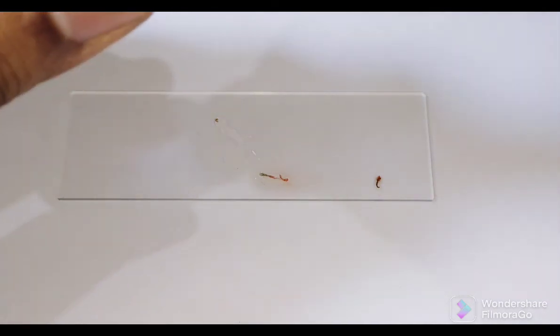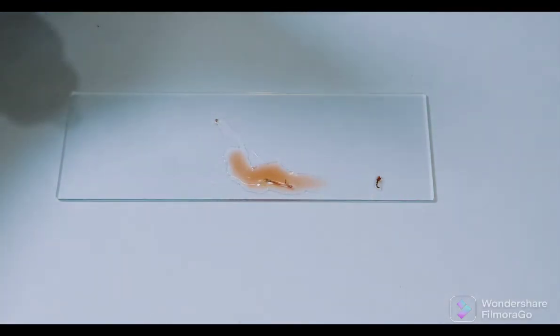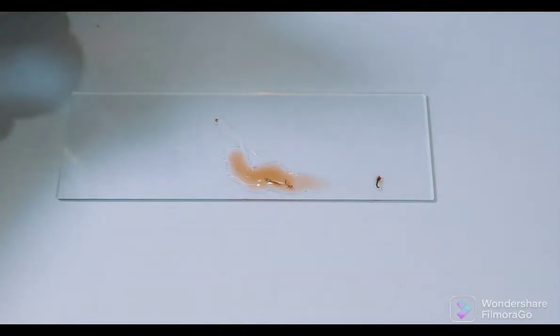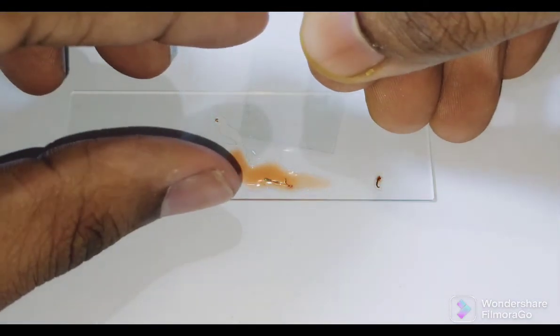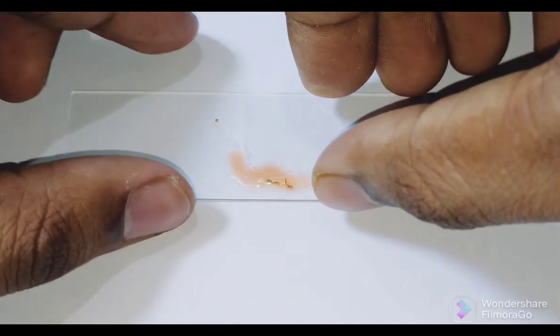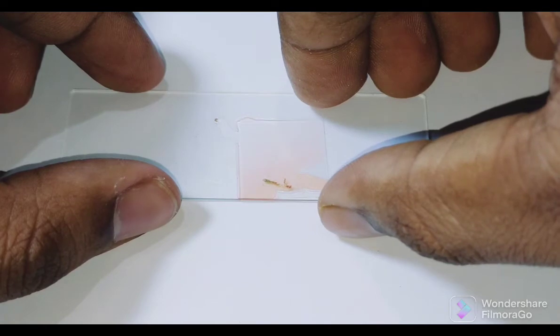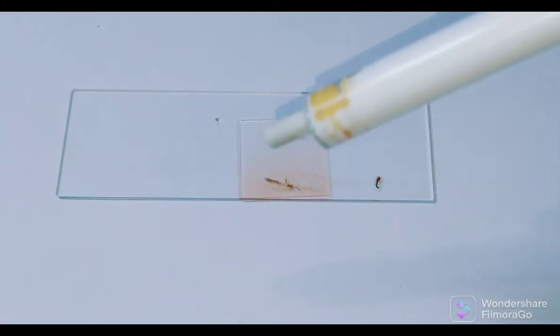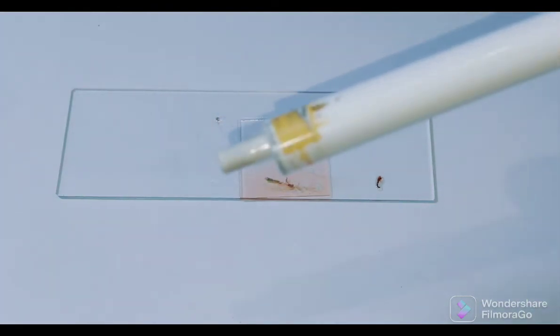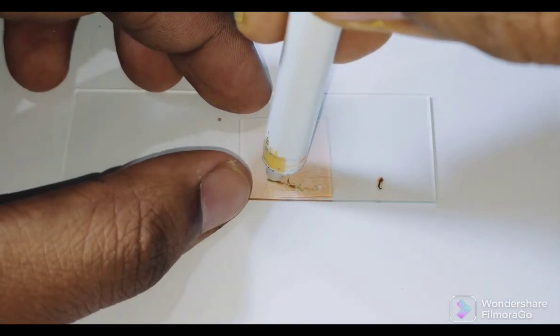Now give the acetocarmine stain to the slide, and place the coverslip over it. With the help of this pencil — the rubber tip is present — press it with the rubber tip so that the salivary gland can be exposed.